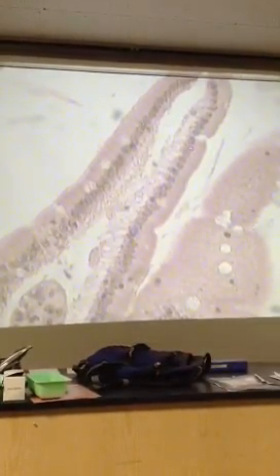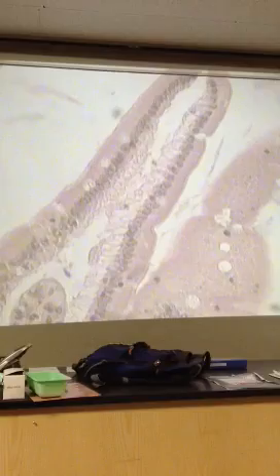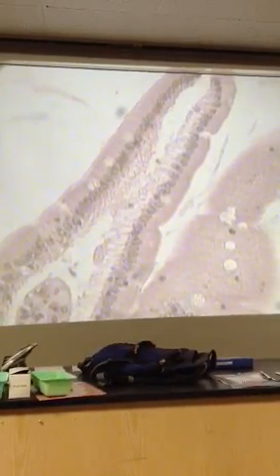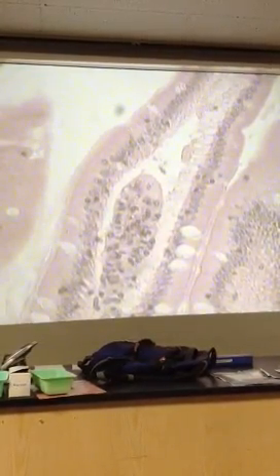Okay, so here's the simple columnar. There's the nuclei. This is inside of the villus. This is where the areolar tissue is. Also, the name for that is the lamina propria. This is where your nutrients are absorbed. Goes across these epithelial cells and into the capillaries and lacteals that are inside the villi. That's how they get into your blood. Okay, what about these? Goblet cells, yeah, and they're supposed to look like a goblet cup, like a wine glass, more or less. Kind of does.